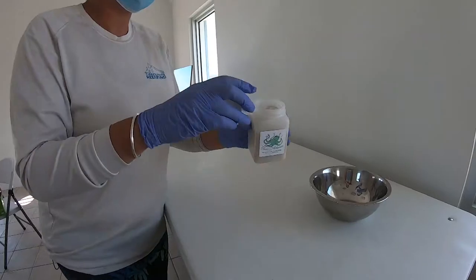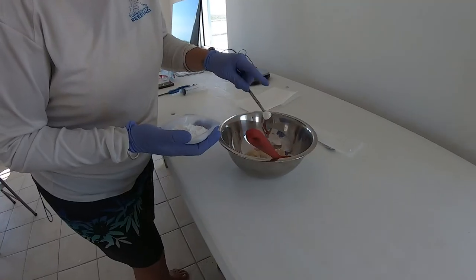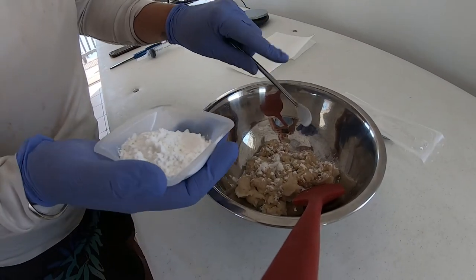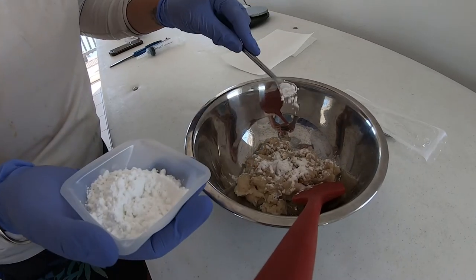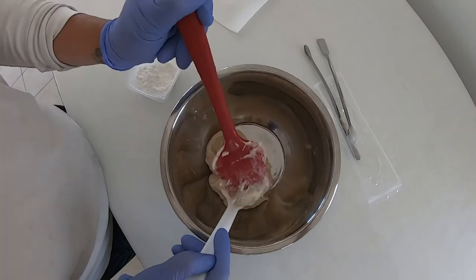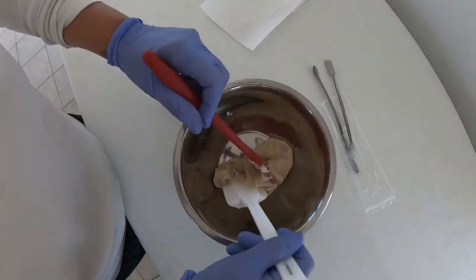The first thing you should do is add the Base-2B to the mixing bowl. Slowly add the amoxicillin to the Base-2B, mixing as you go, in order to make sure it gets fully incorporated. If you have two spatulas, one can be used to mix the compounds together while the other can be used to keep the bowl from moving around.